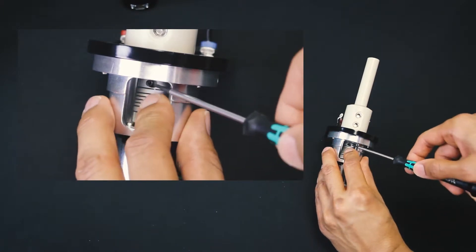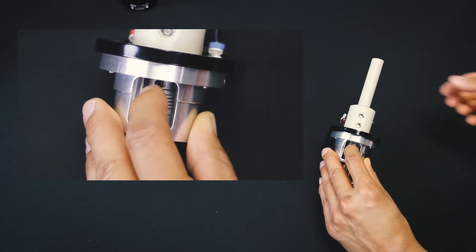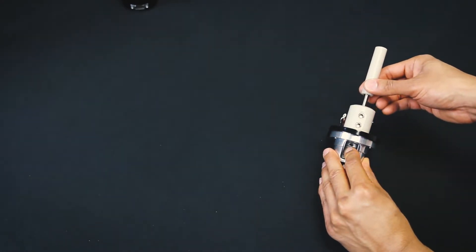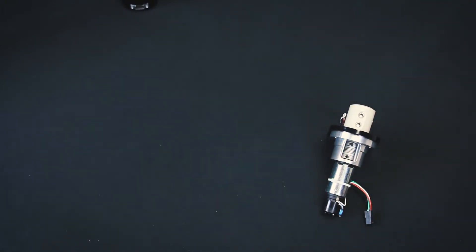You do not need to remove the screw completely. Once the screw is loosened, pull the shaft out of the motor head. The shaft should slide out with little to no resistance. Place the shaft where it won't fall or get damaged.